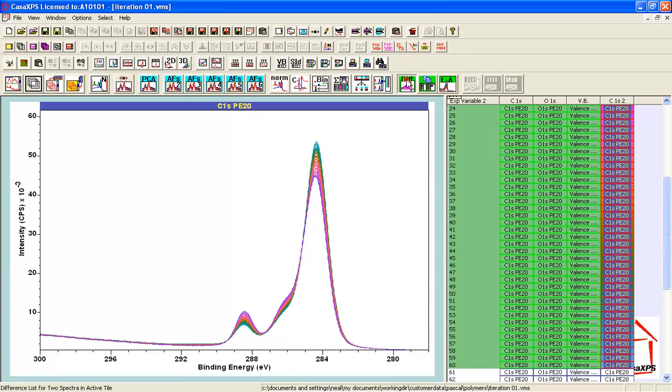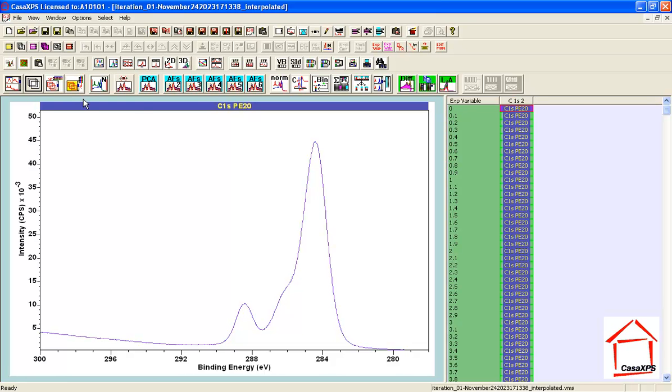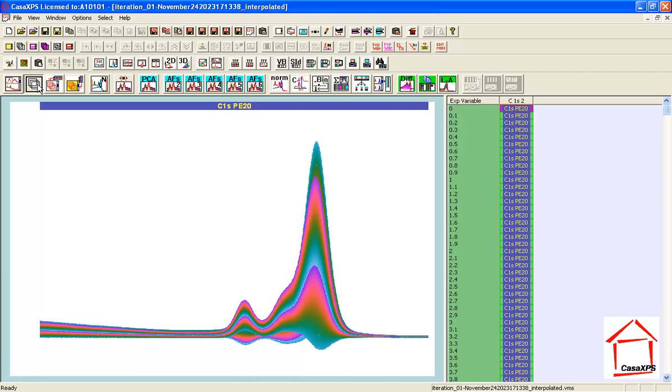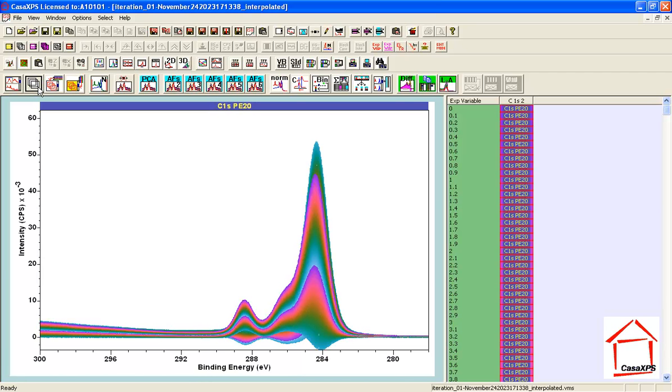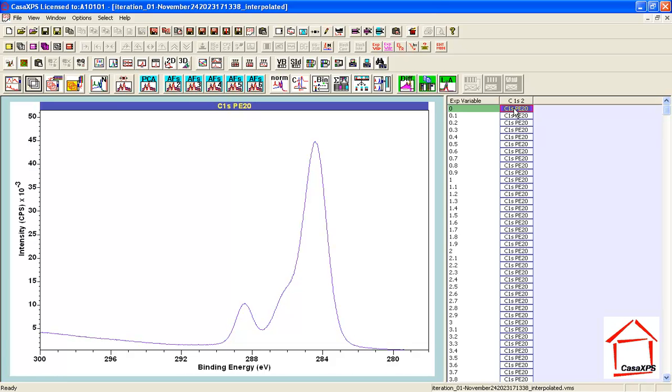So when I press the difference button, this calculates the difference between the first and the last in the list that are selected and presents a new file that contains a series of difference spectra, which I'll overlay, and you can see there are a vast range of shapes from which I would like to pick out at least one that looks like PMMA. Now I have a good idea of what PMMA ought to look like because the very first measurement should be very close to PMMA. So let's start searching.